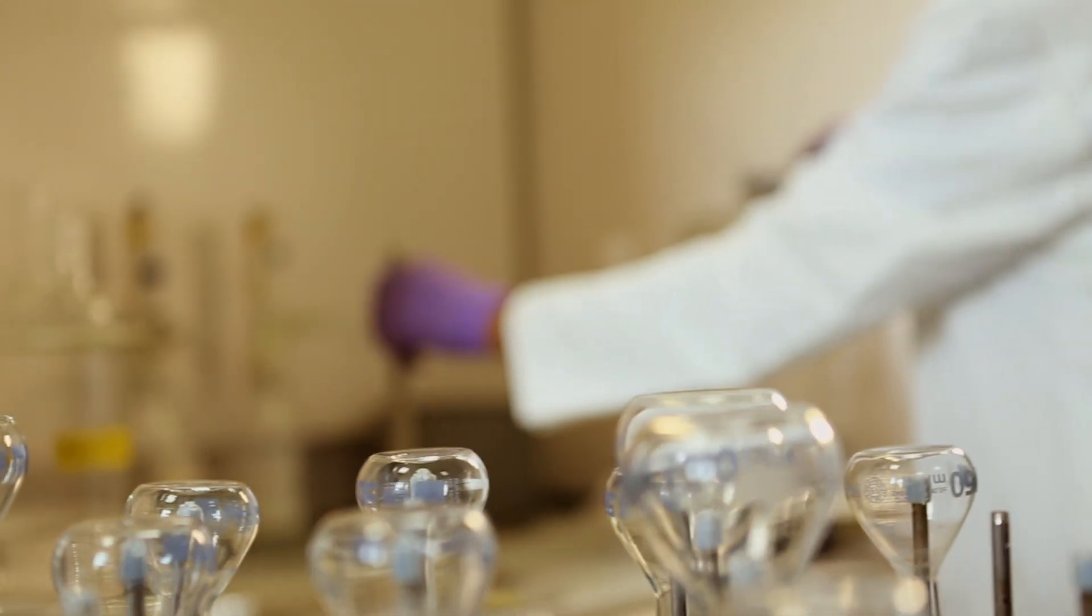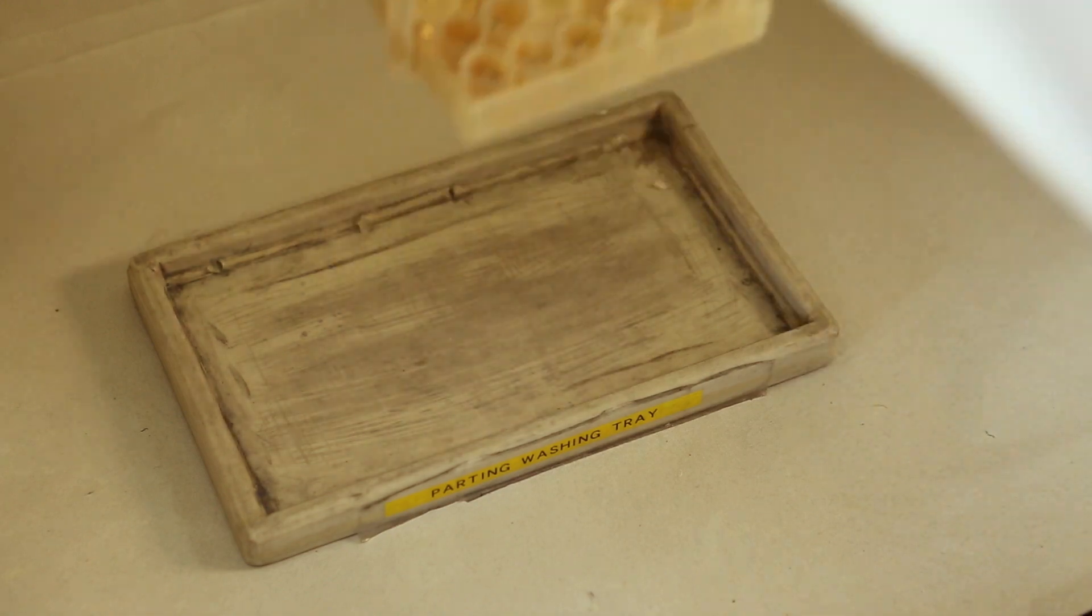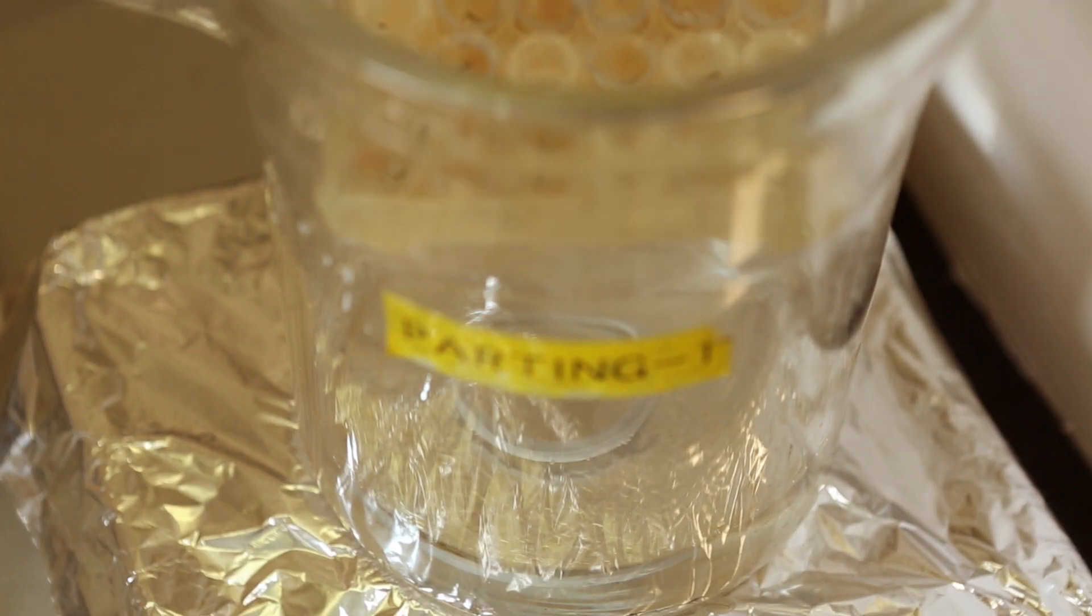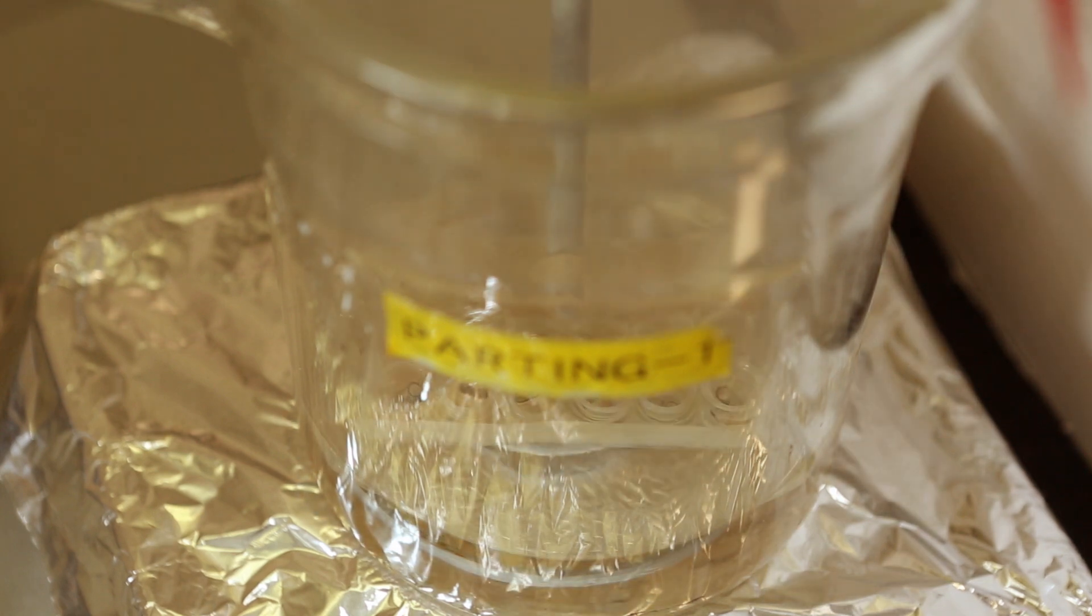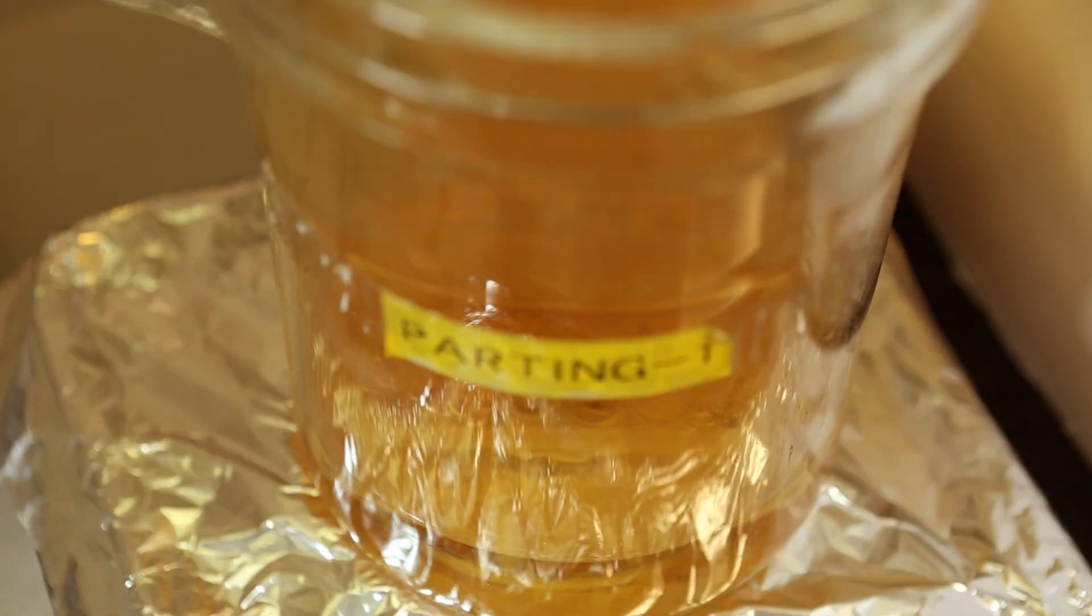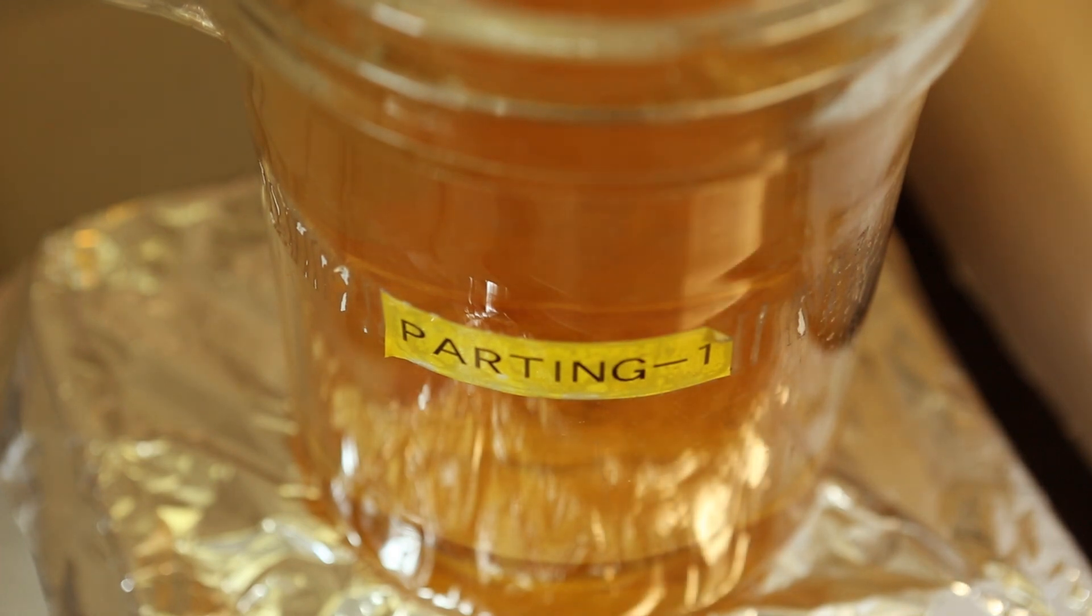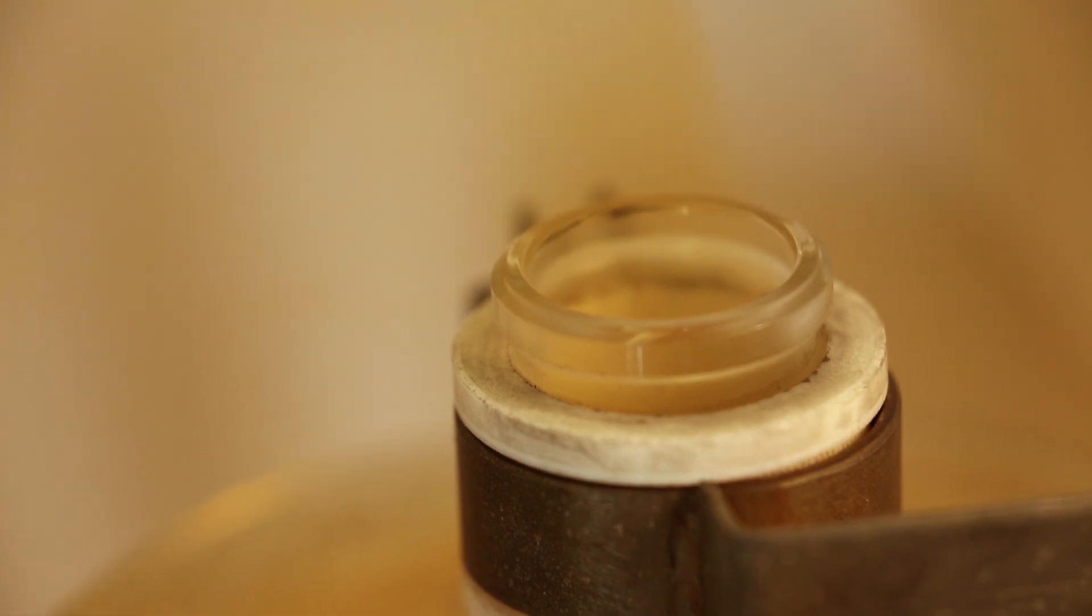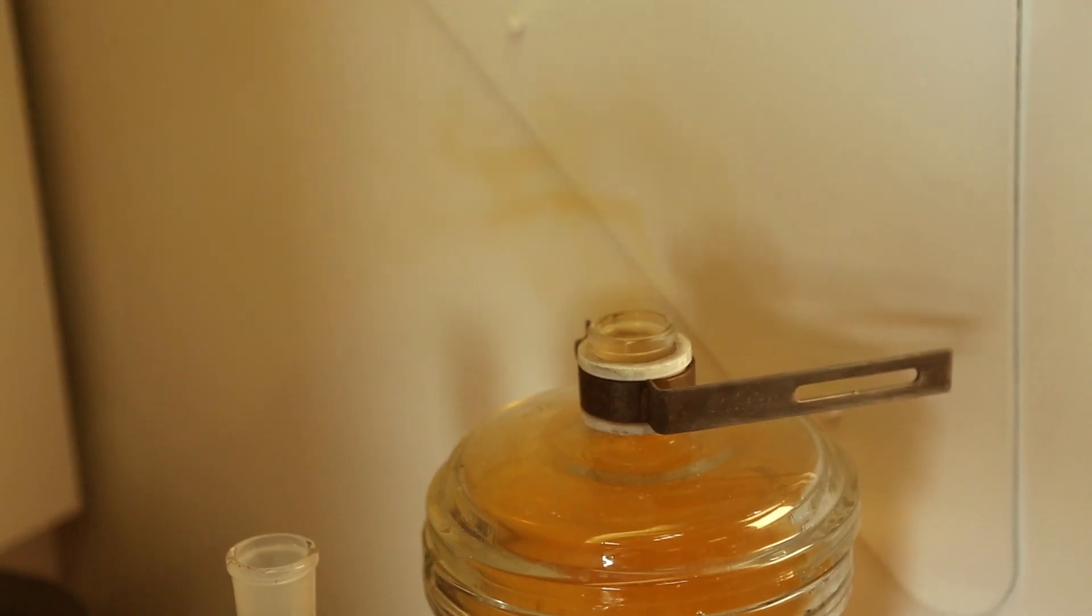The cornets include silver which must now be eliminated by a process called parting. The cornets are washed twice with concentrated nitric acid which completely dissolves the silver without affecting the gold. All the silver has now been flushed out, leaving behind just the gold.